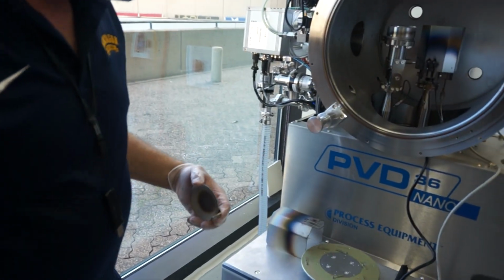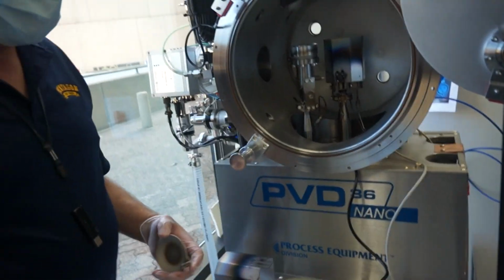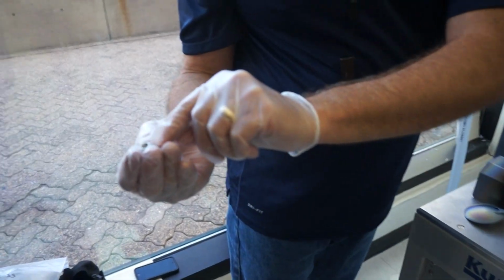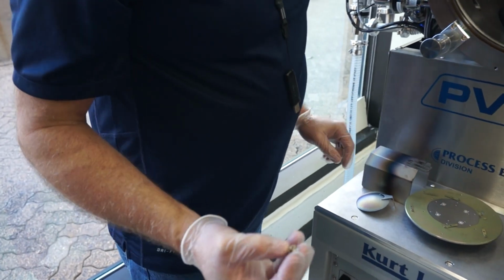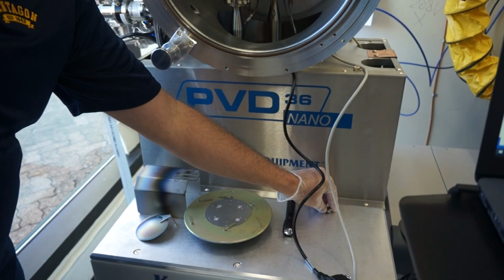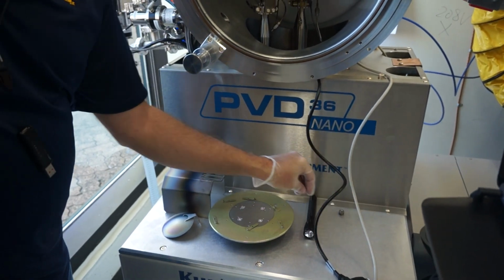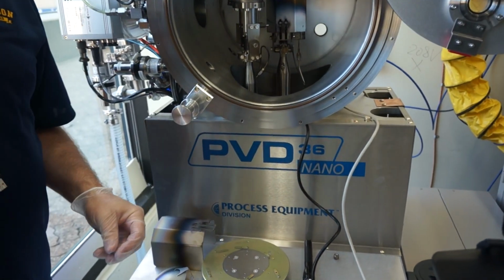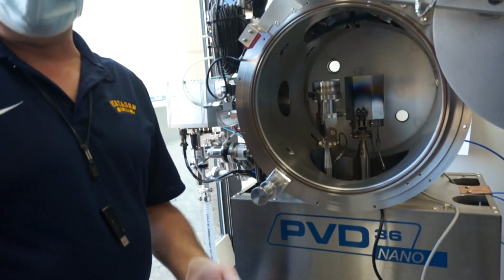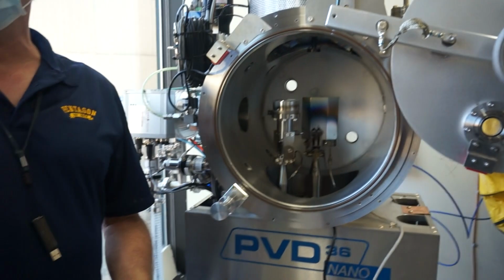Now, something I wanted to show you, and I pointed this out yesterday: depending on the vendors we purchase products from, you notice that there's a small recess within this. It's really not a big problem on here, but I don't know if you've ever worked with trapped volumes in systems. If you have a blind hole that's not vented and you evacuate a system, there could be trapped gas in there continually trying to come out through the threads.